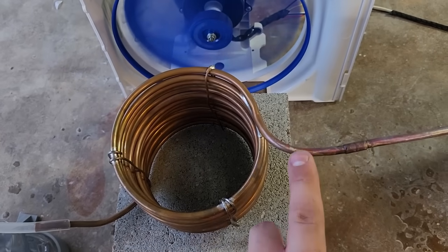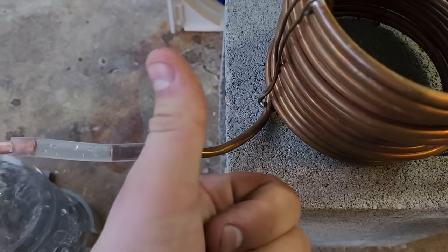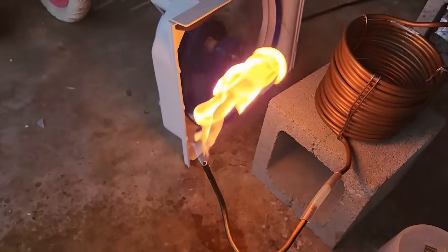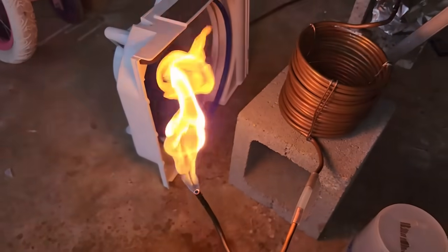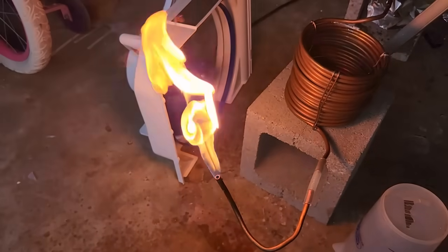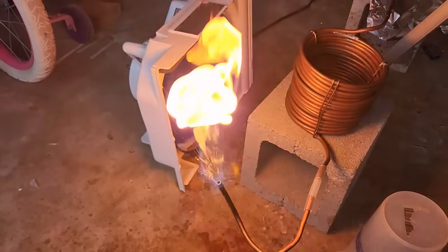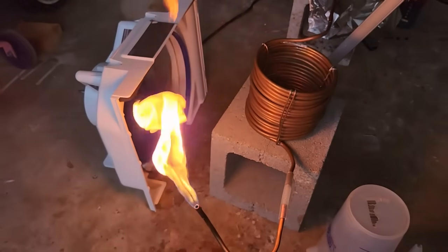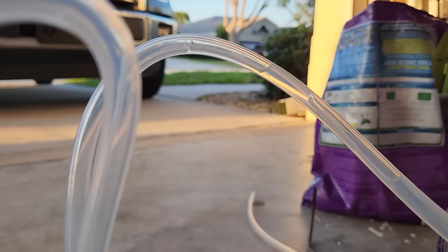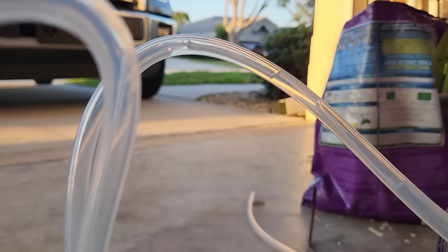The condenser seems to be doing its job very well because it's extremely hot to the touch on the inlet, but perfectly cool on the outlet. When I remove the filter dryer assembly, you can see the liquid spitting out with the surge of flame. This is mostly liquid water, but a small percentage of unreacted ethanol and possibly liquid ether. The surges occur from so-called bumping or uneven boiling — I need to add some boiling chips or sand into my flask to even that out.